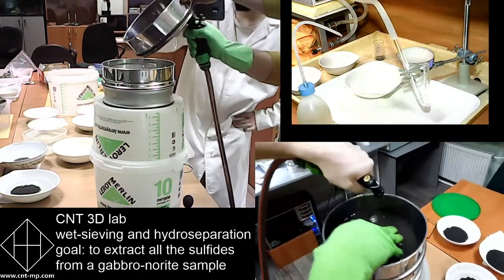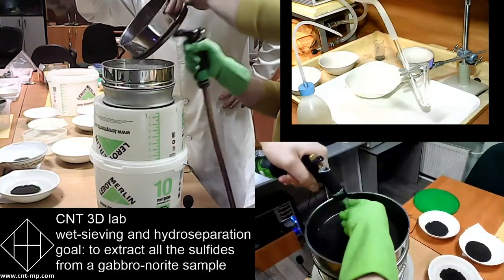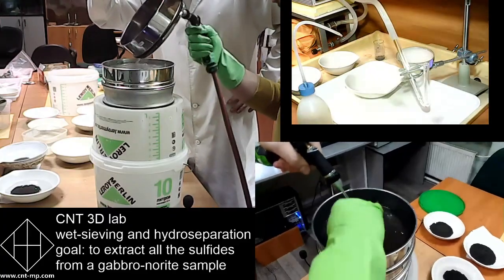So you can see another sieve. He is going through another sieve. All that went through 0.5 millimeters went to the sieve below.